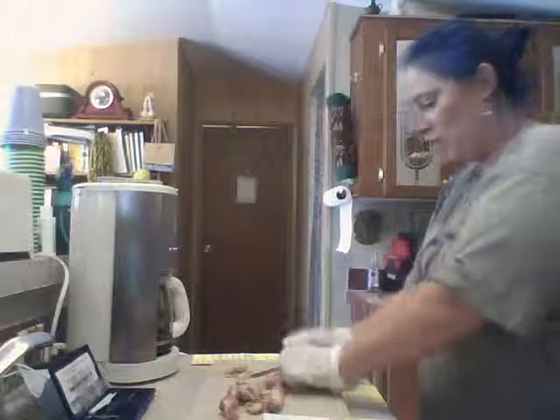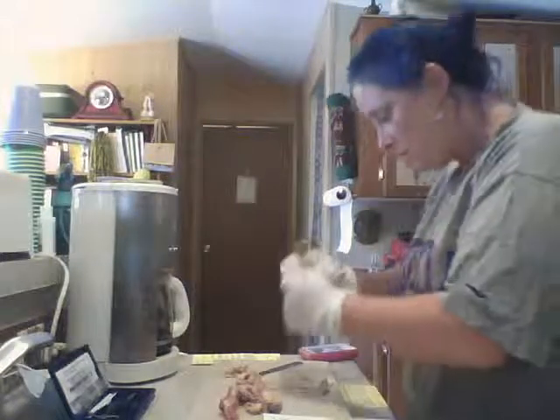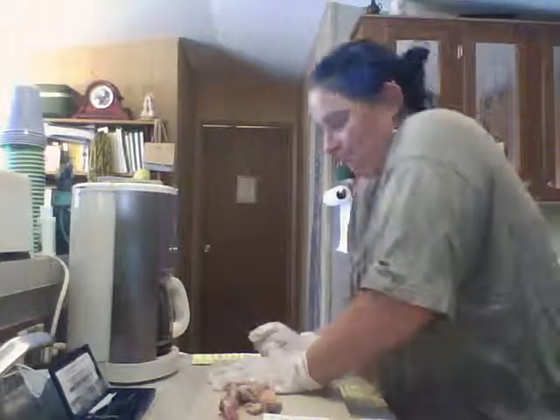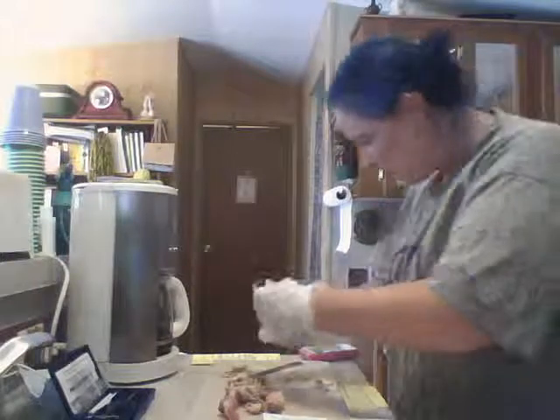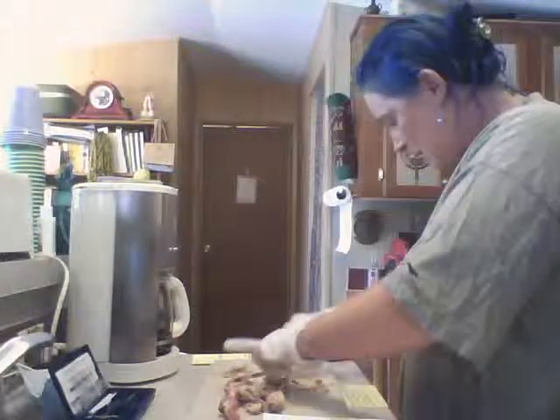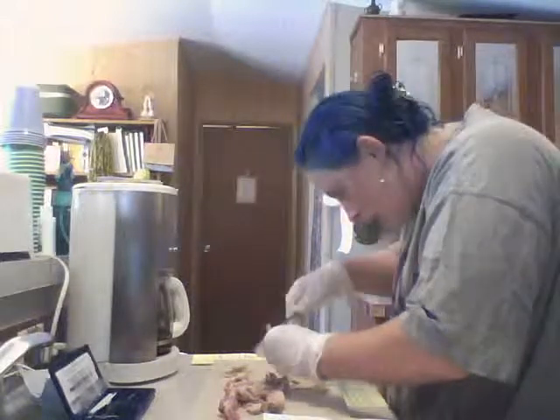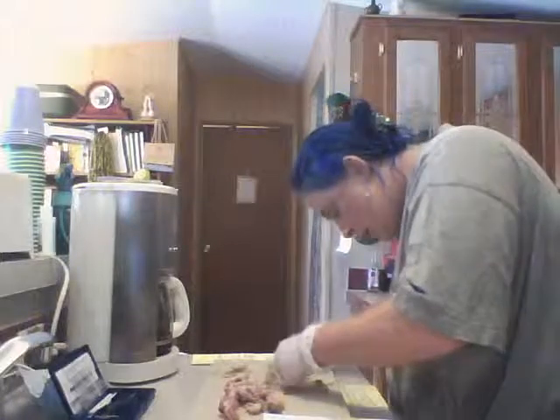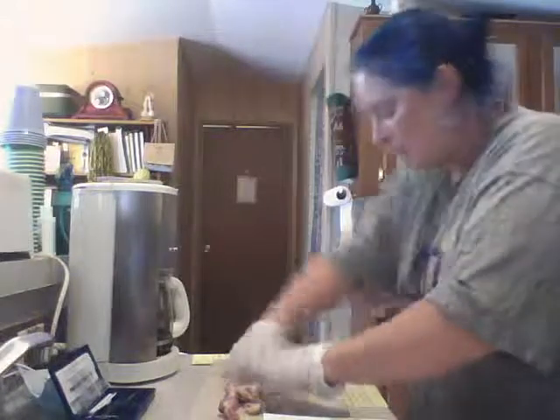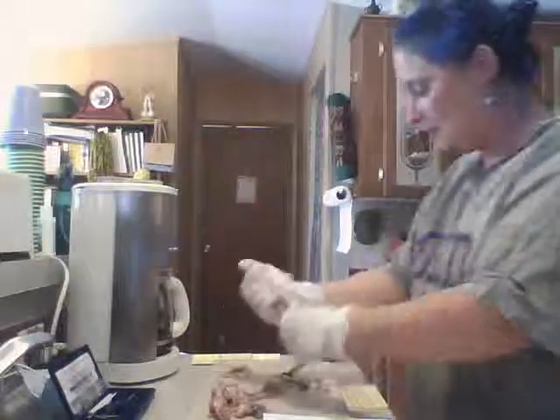Okay, trying to break the diaphysis. Is this gonna break? Maybe not.